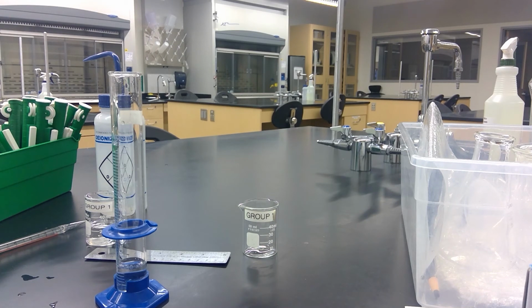Note, this is a separate measurement from the measurement that you made with the pipette. The volume may not be the same, and the number of reported digits will certainly be different.